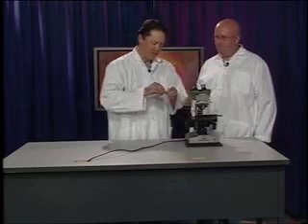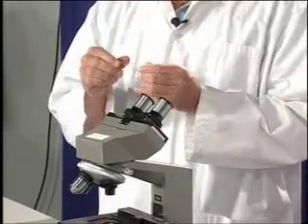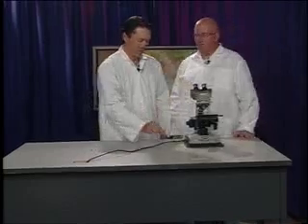This microscope, Jeff, is used to look at very, very small specimens, organisms. It has capabilities to magnify about 400 times normal power. So I could see something like an ant? Oh, you could see the small parts of an ant. An ant would probably be too big. You could see cells. You could look at small microscopic organisms. I'm interested. Okay. I want to see that.